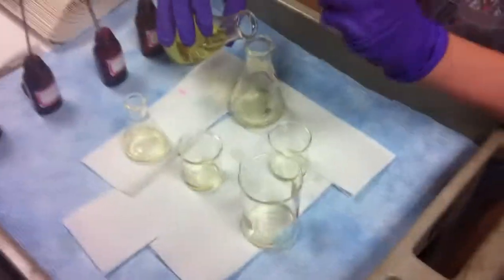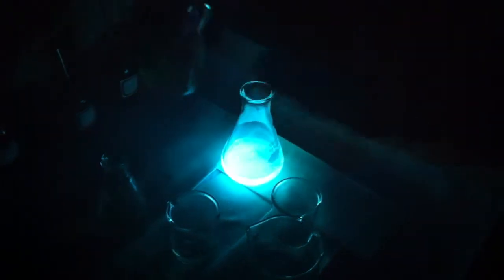What dye are we using first? None. None. This is straight up. Okay, you can turn it on one more time. I can't see what I'm doing. There, I'll get it too. Let's go. Wow. Whoa.